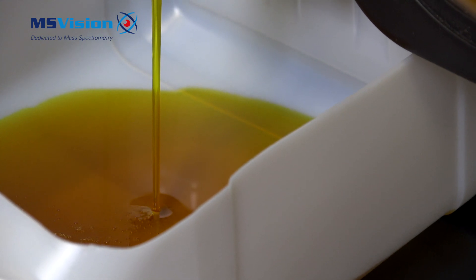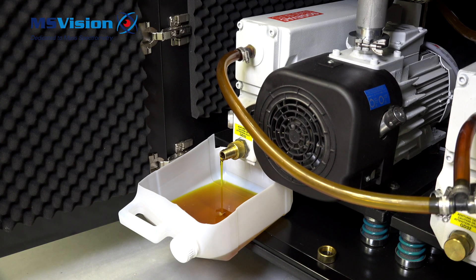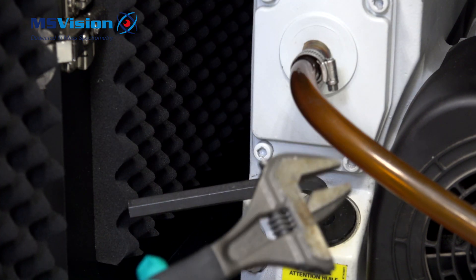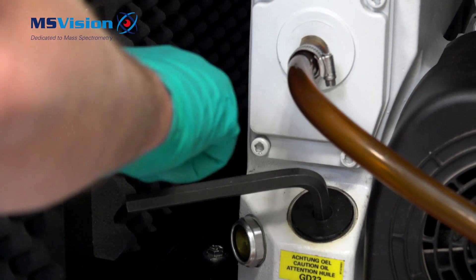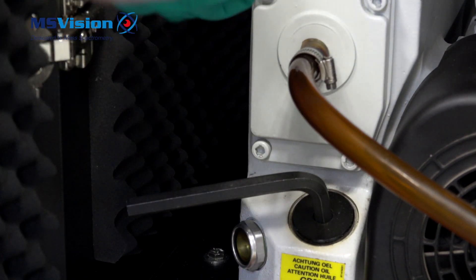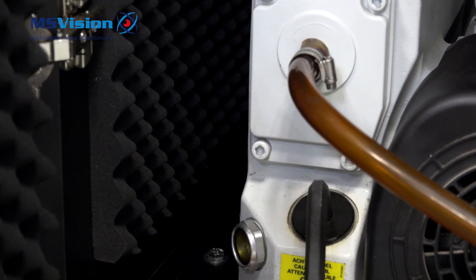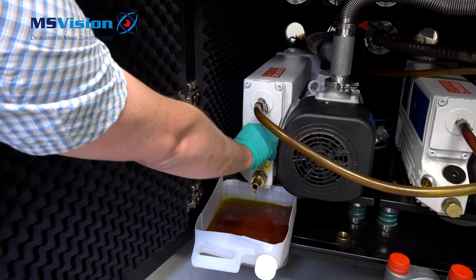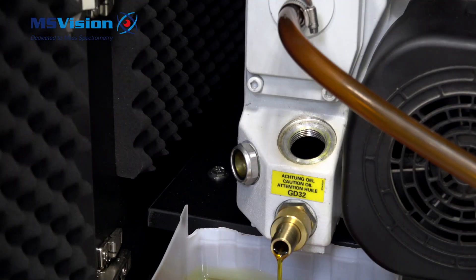To speed up the draining you can now open the filling port. You need a 12mm Allen key — insert it into the filling port cap. Usually it's quite tight, so use a heavy tool to turn it anti-clockwise to open. Unscrew by hand and be careful not to drop it into the waste oil. Safely dispose of the waste oil.